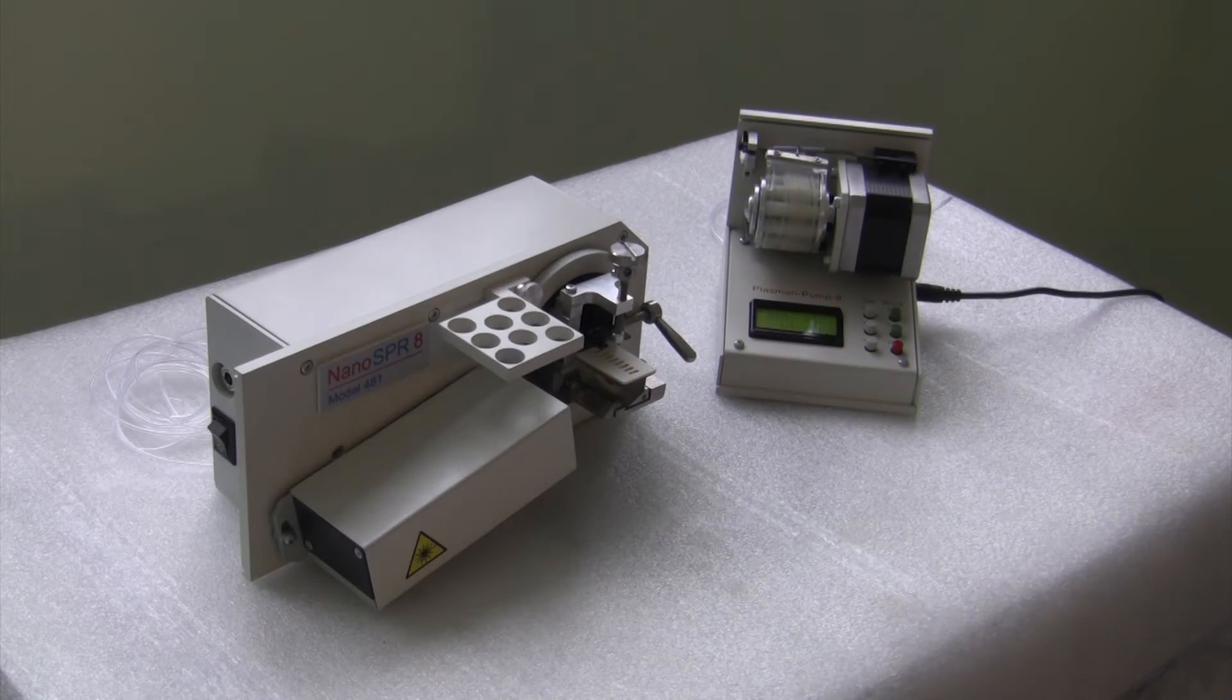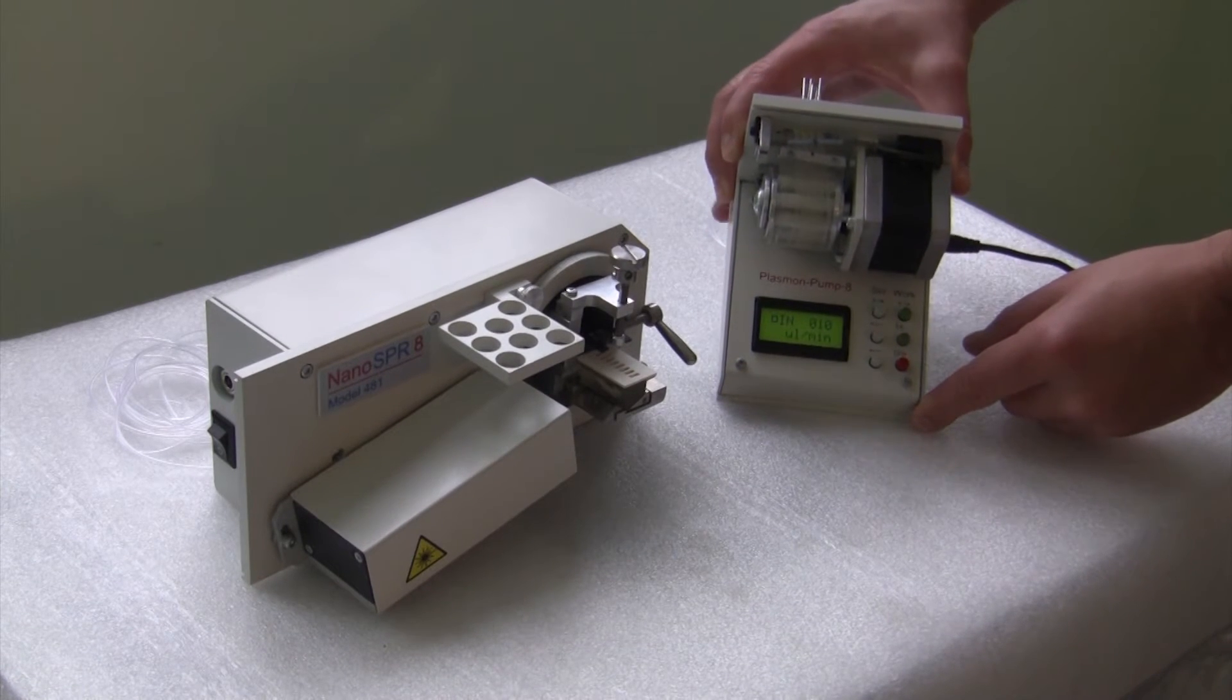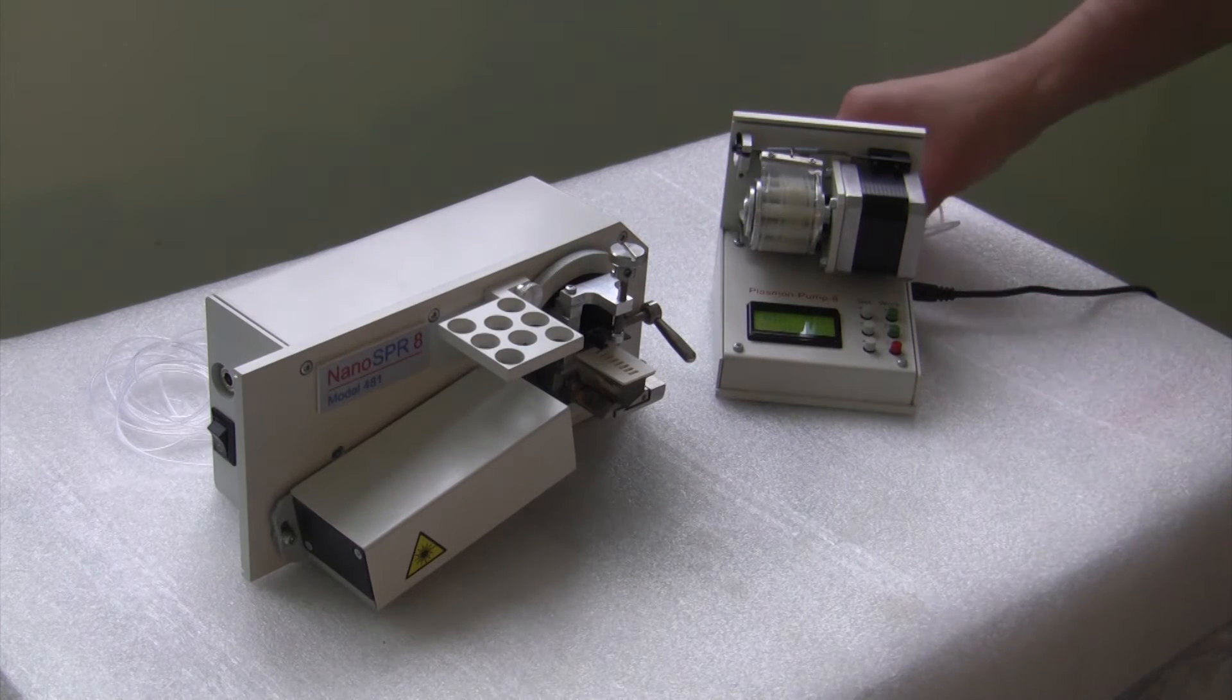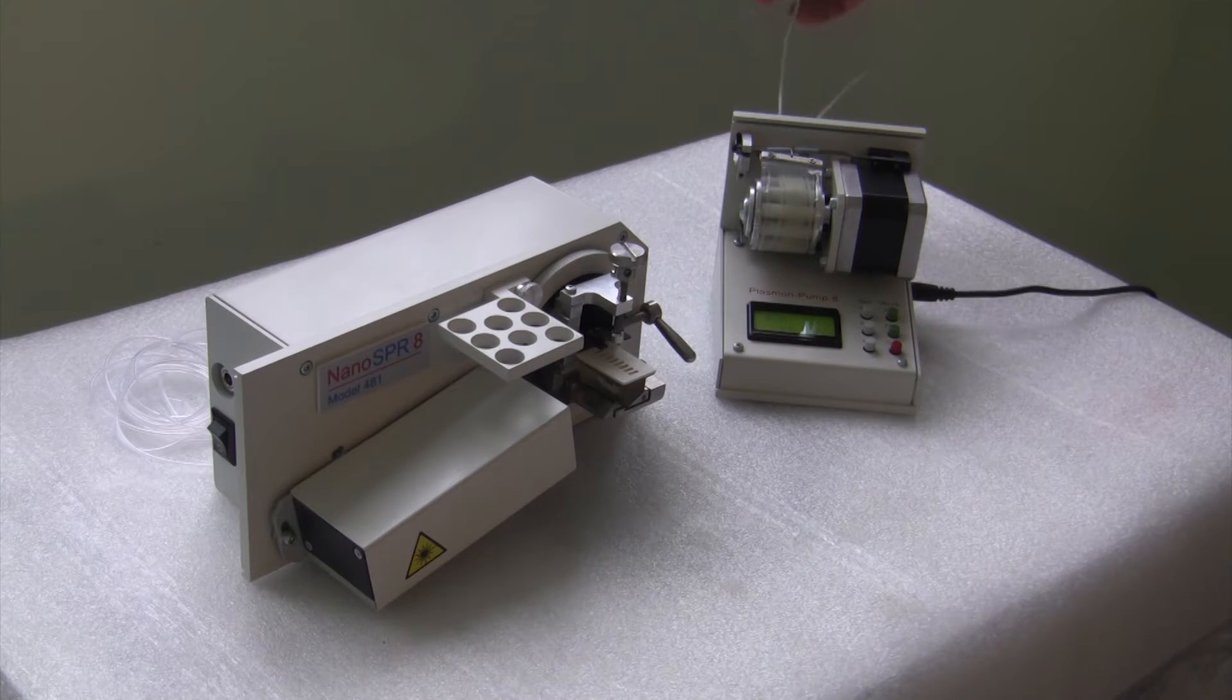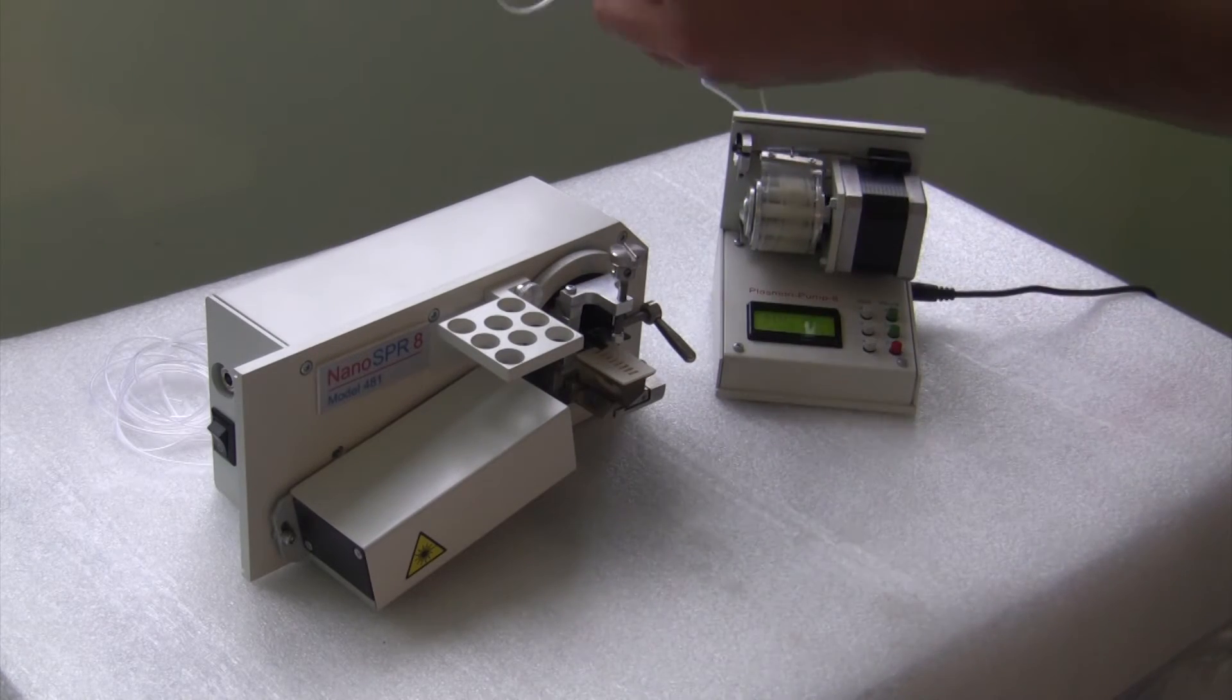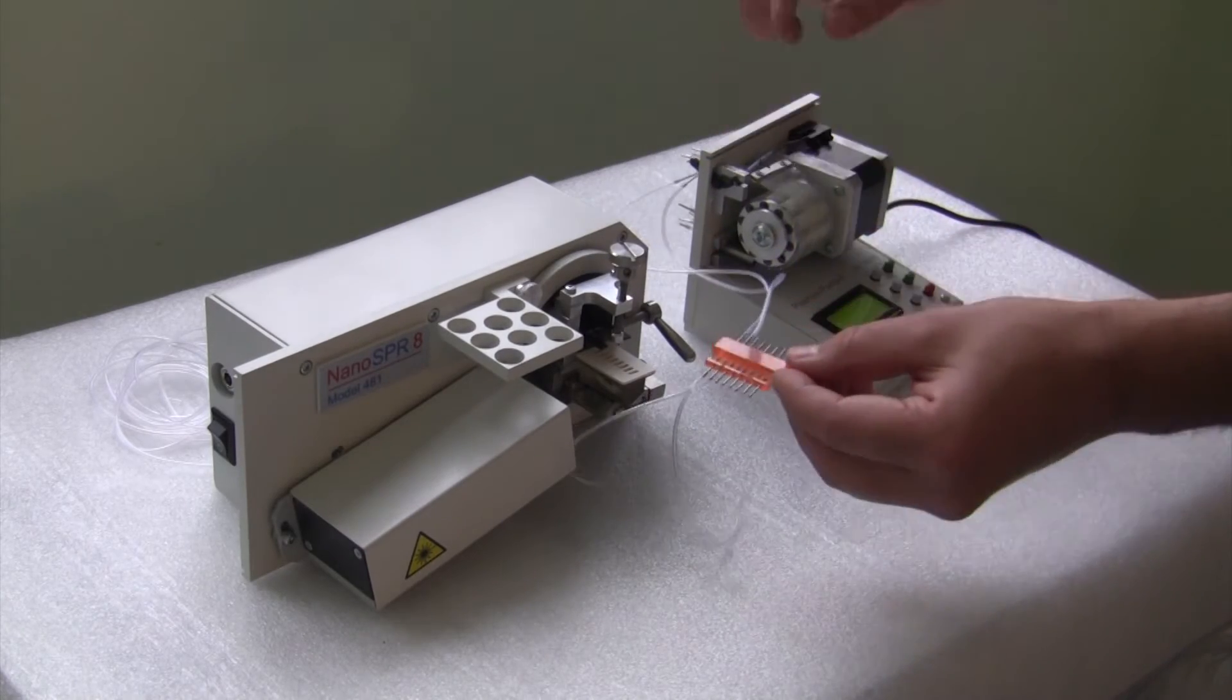Now, let's connect the tubing to the cuvette and install the cuvette to the optical table. I would like to mention that we also offer an optional thermo heating cuvette as well as thermostabilization chamber for the device.